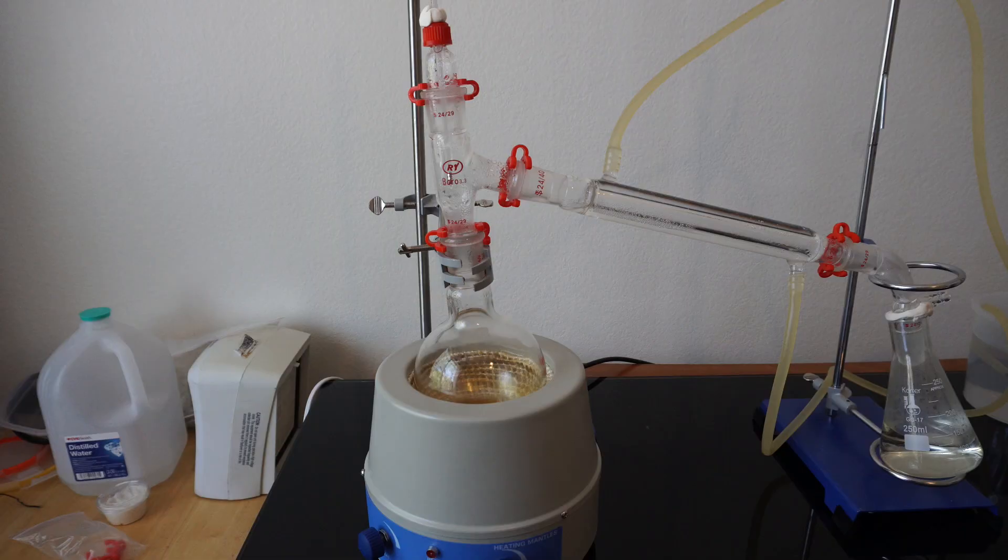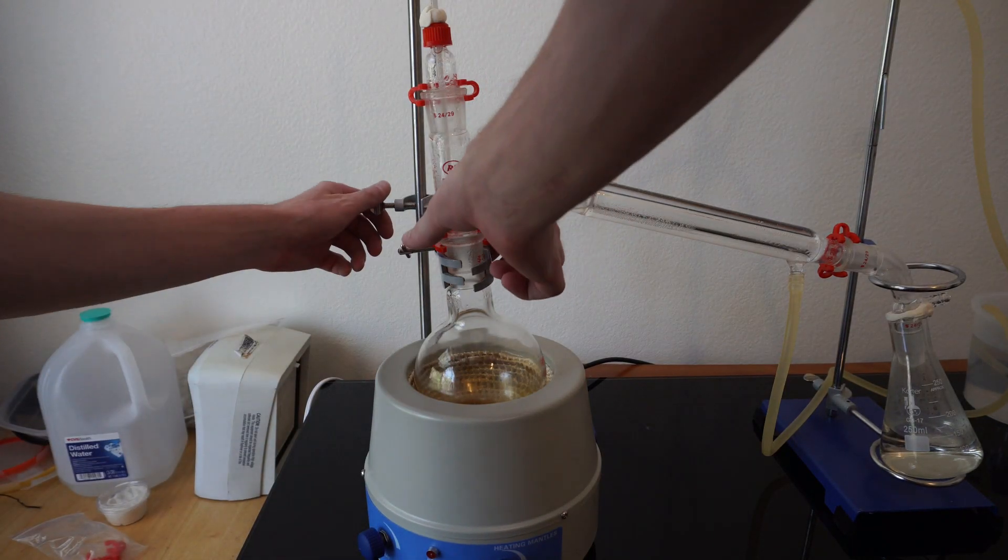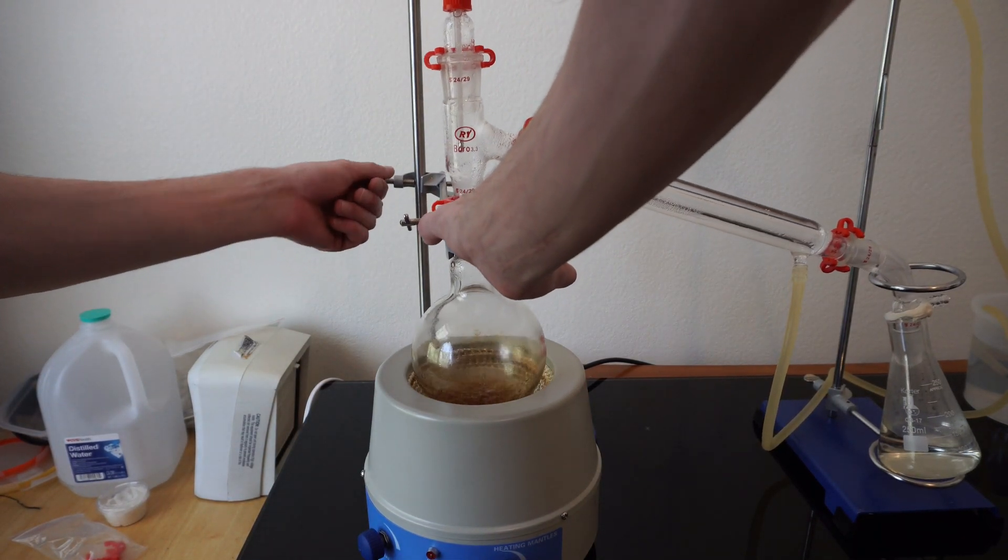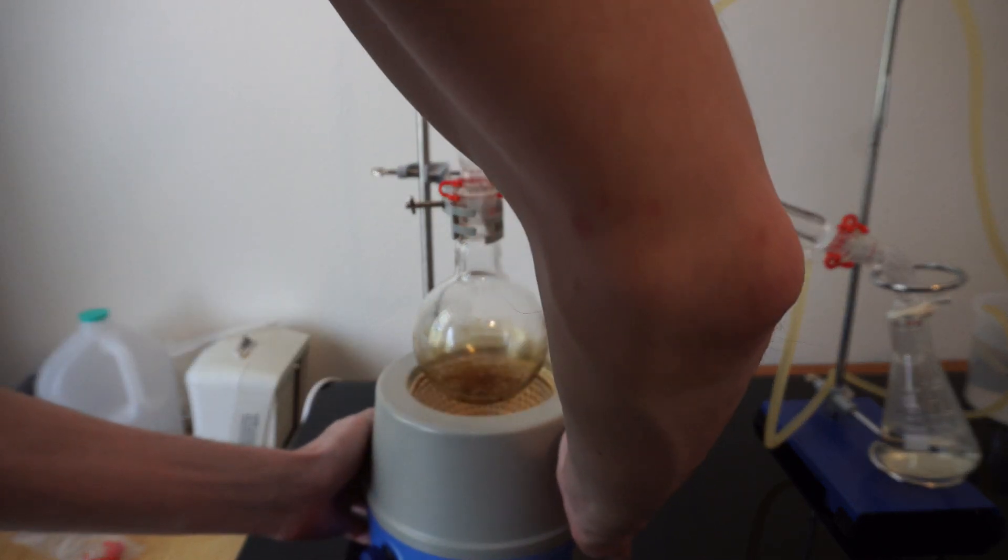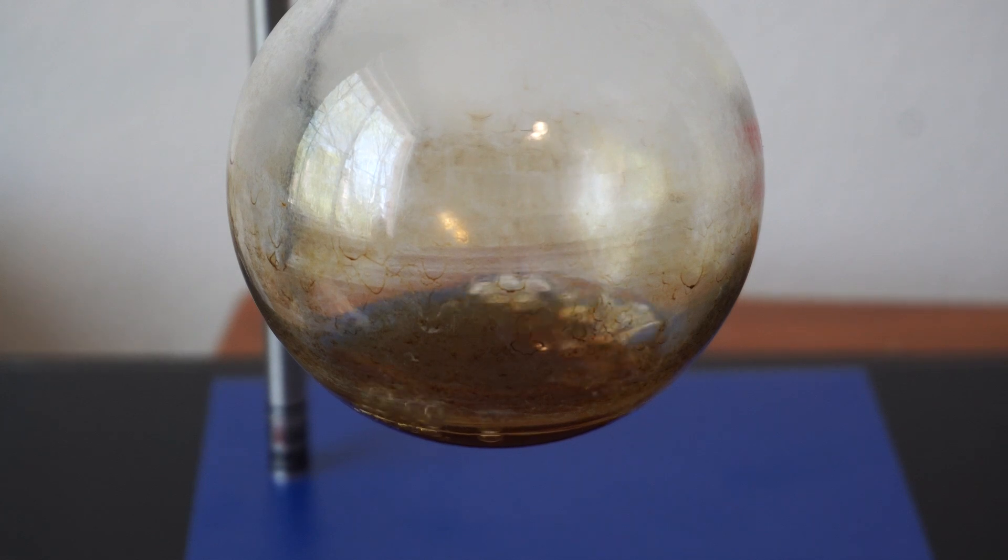Once the water has been mostly removed, we can see our oil still boiling. I believe I possibly let this overheat, which gave it the darker color we see. However, its scent profile is very similar to rosemary.